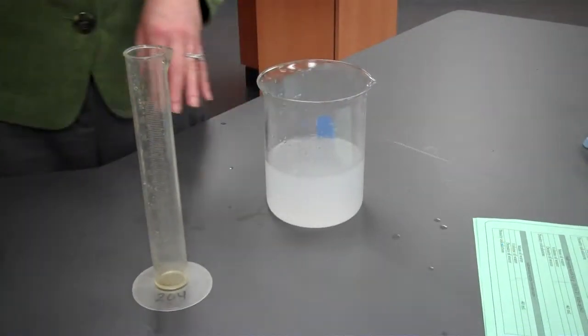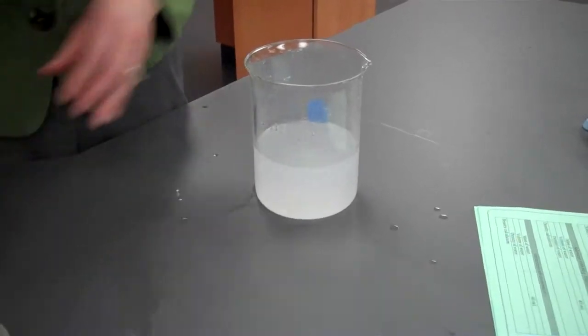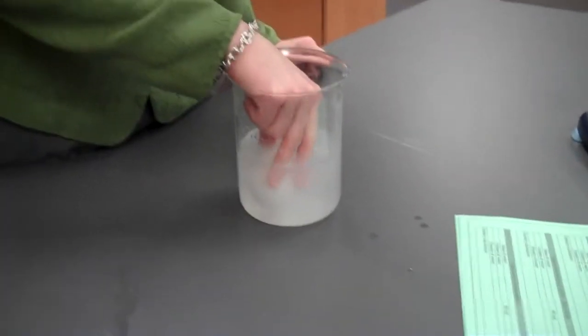We're going to put the egg inside of this solution. This is 50 grams. You're going to make your observations. Does it float? It's a little bit harder to see. You can definitely spot a difference. Would you say it's floating, yes or no? We're going to remove the egg.